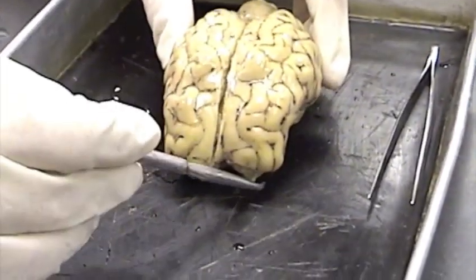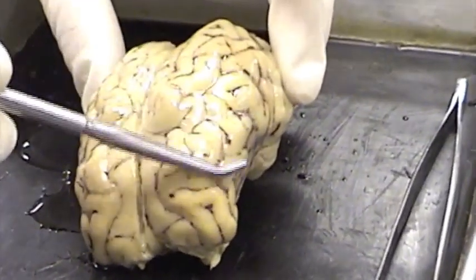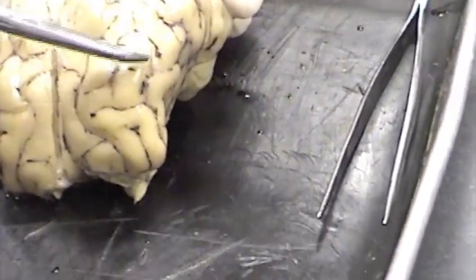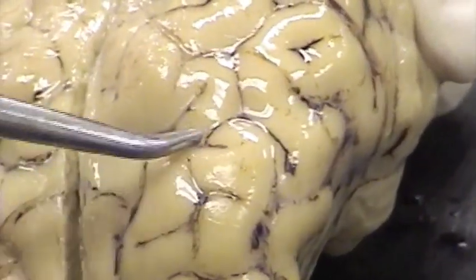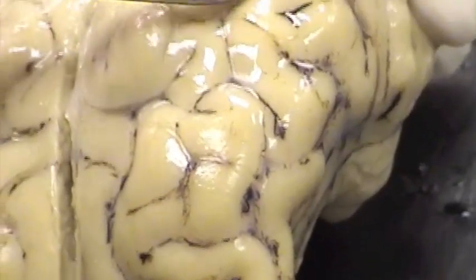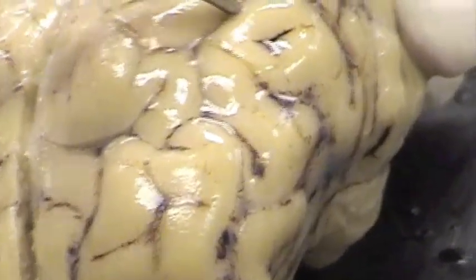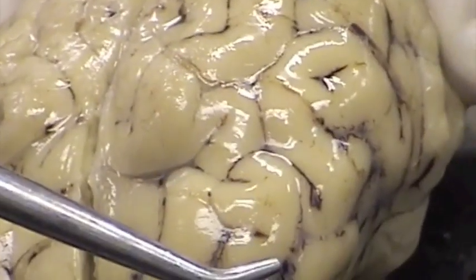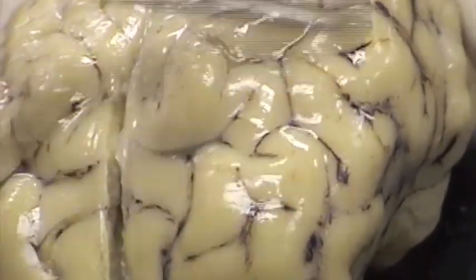This brain has had the dura mater removed and we are able to see that this part of the brain is covered with the arachnoid mater. It's kind of like shrink wrap. If you get a close view here you can see that there's sort of a covering as I run my probe over the sulci of the brain — the grooves are the sulci — I can't get the probe down into those grooves. I can't get into the sulcus without penetrating this very thin cellophane-like, shrink wrap-like layer called the arachnoid mater. So here's the arachnoid mater covering this whole hemisphere of the brain.